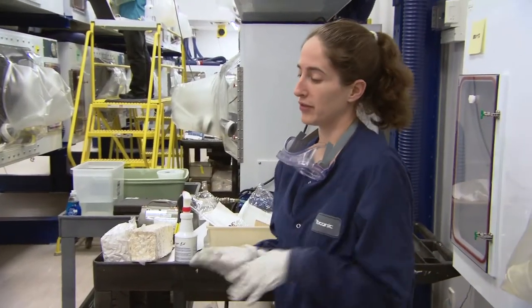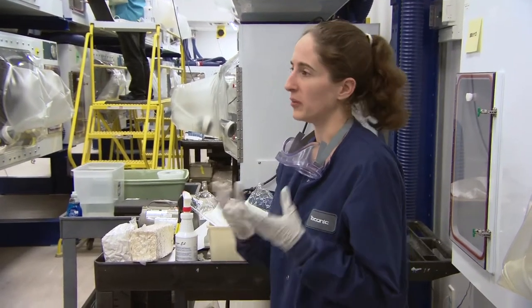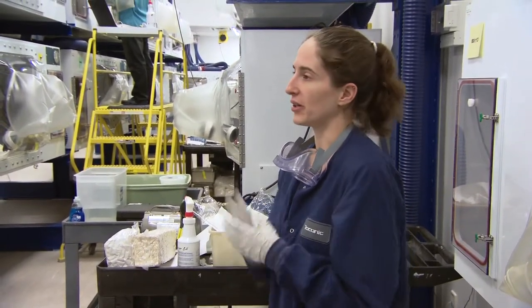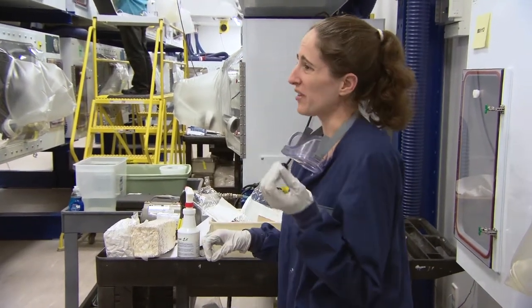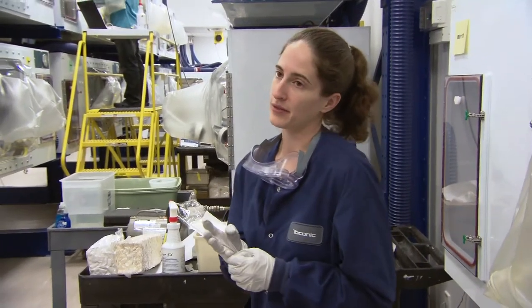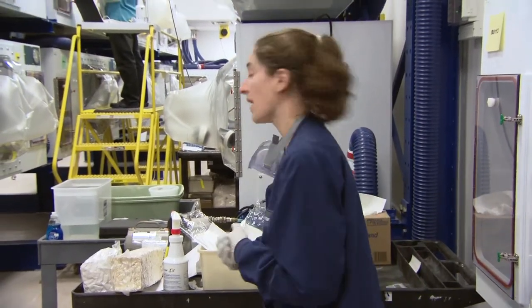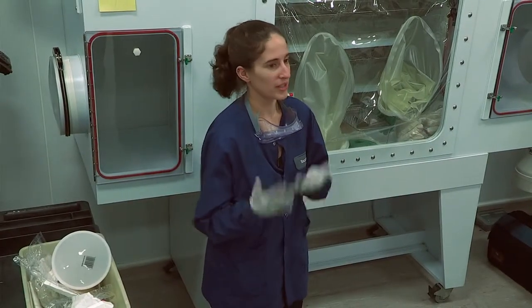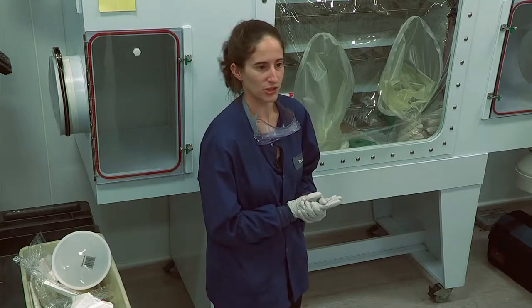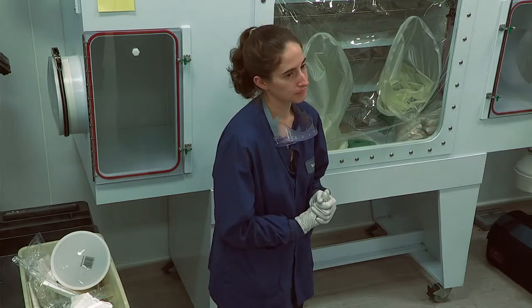When they come in from another facility, we'll put some of the hydrogel they're usually transported with in the bottom of the cage for the first day or two, but they seem to go right over to the Hydropack — they know what to do. Sometimes the rats will chew on the valve, but the bag still operates just fine. The tips are irradiated — but can they also be autoclaved? These tips can't be autoclaved for the Hydropack, I don't believe. They come already irradiated from Hydropack — you purchase them that way. So that would be something you'd have to send out for an extra dose — not sure what the dose is.